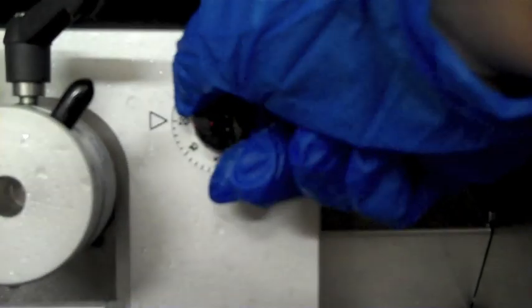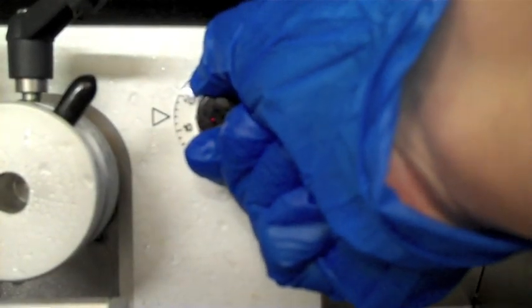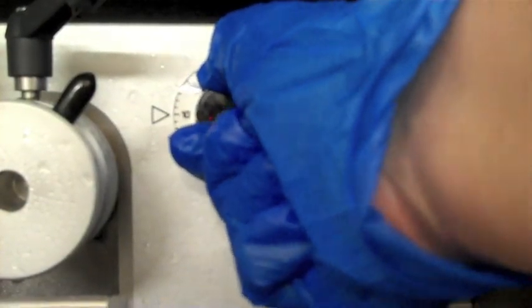Decrease the section thickness to approximately 10 microns. Discard the first few slices after you have changed the section thickness. Close the faceplate to prevent curling of the sections. Move the crank in a slow but purposeful manner. Make sure your specimen is completely cold before you start cutting.